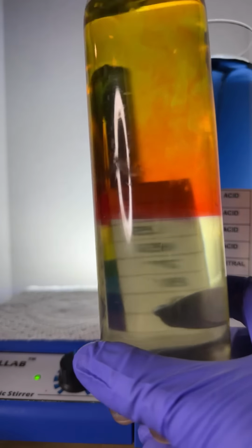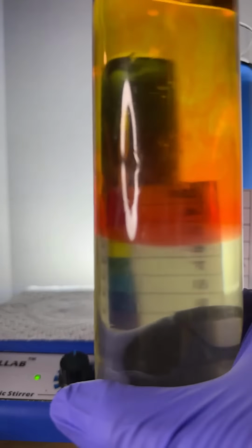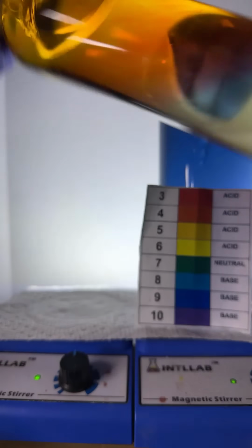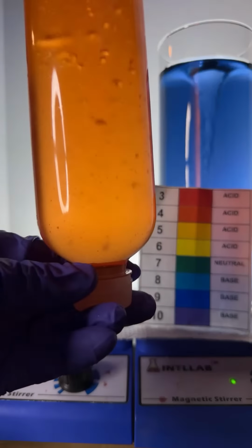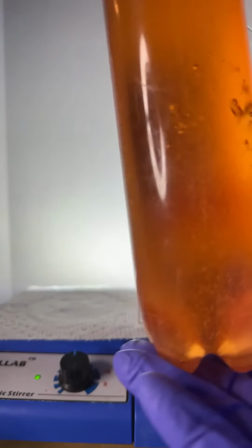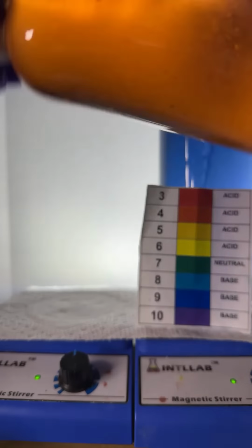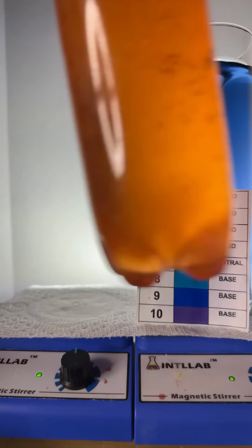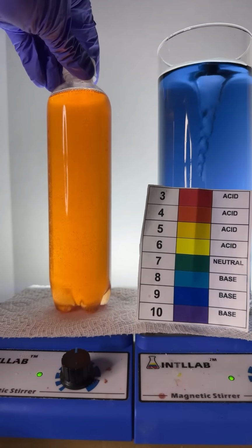All right, here we go. I don't have any calcium carbonate with me, Sabir. All right, here we go. Let's shake that up. And everything should turn like an orange or a red color. David, the bottom of the bottle is cloudy because not all of the salt dissolves. So that's what's going on there.